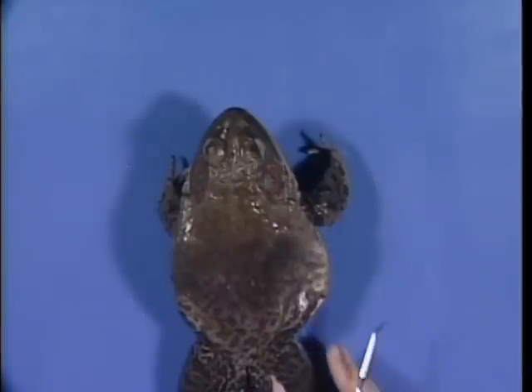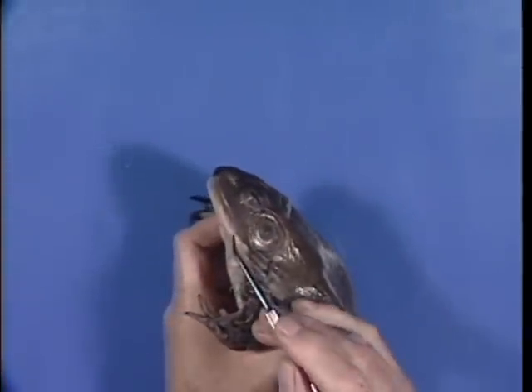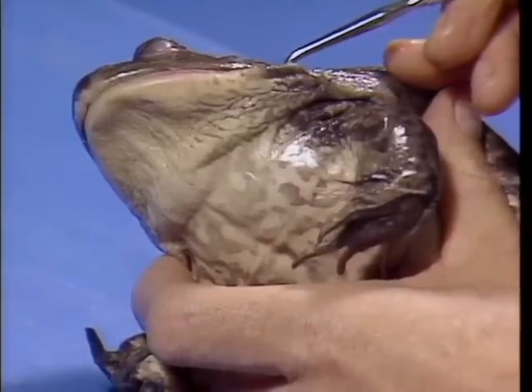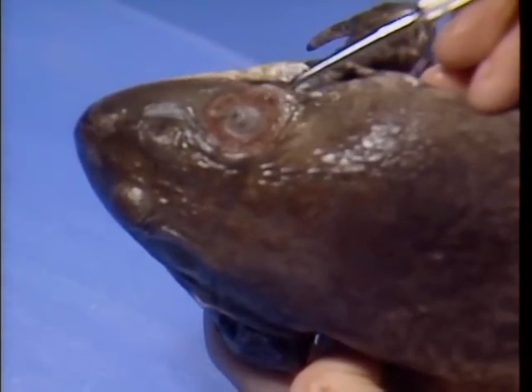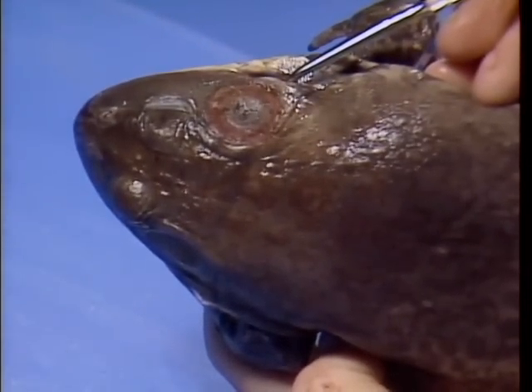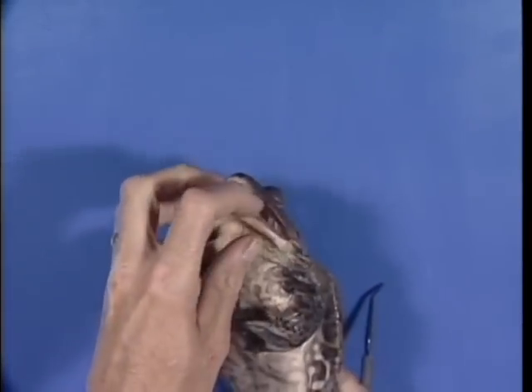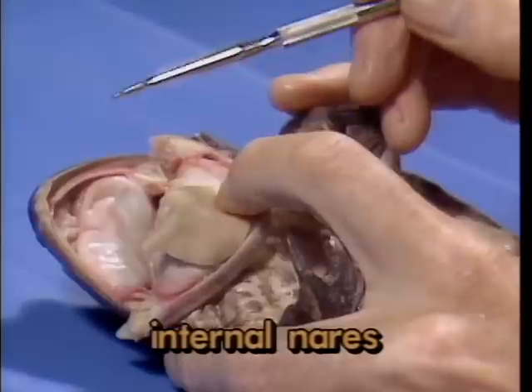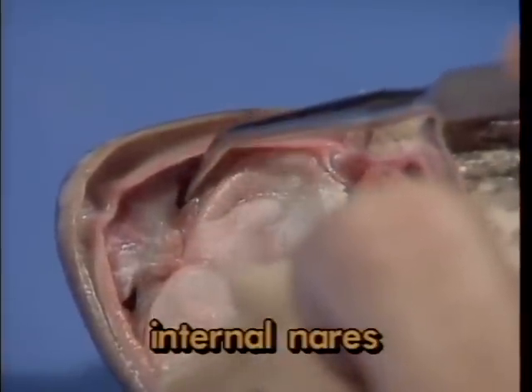In order to observe important features in the mouth, first cut the bony junction between the upper and lower jaws at the posterior margin of each jaw here and here. Heavy shears are useful for this purpose. Notice first that the roof of the mouth has paired internal nares, seen here and here.